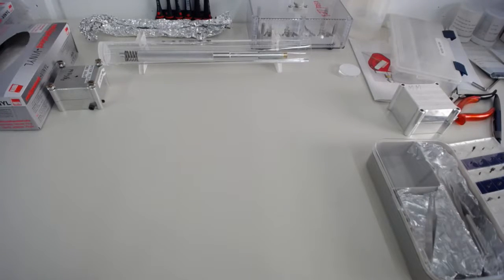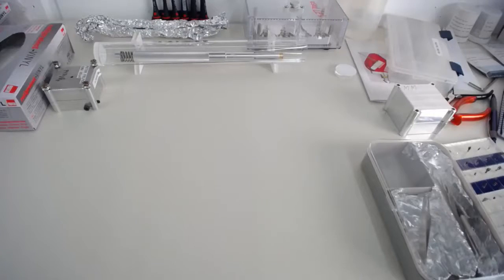Hello and welcome back to my tutorials on how to operate a local electrode atom probe. In the first video we had a look at the general layout of a LEAP instrument, and you know that it's all ultra high vacuum and we need to keep it clean. The next step we're looking at is actually how to insert samples into the atom probe, specifically putting your samples into the sample cartridge, which is called the puck, and from there on moving into the atom probe.